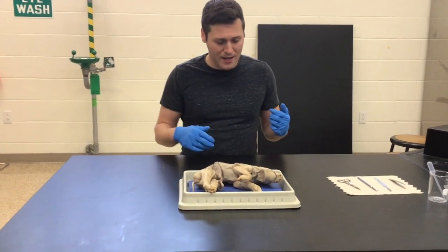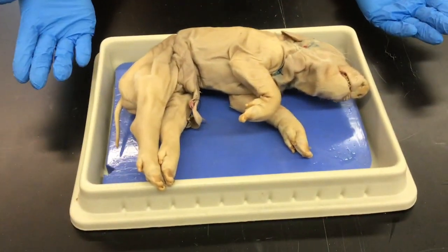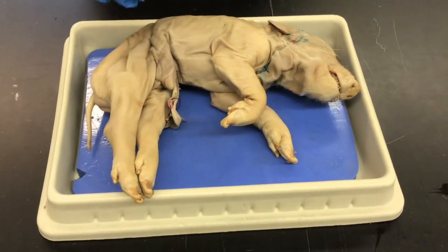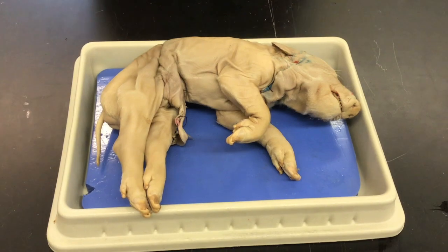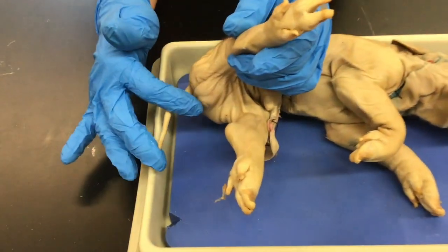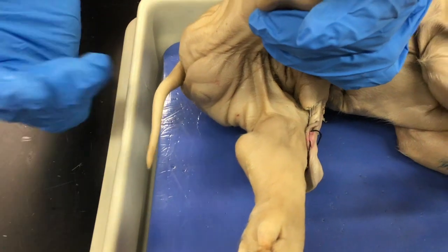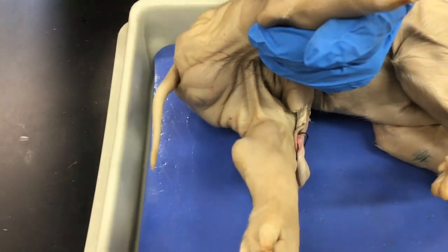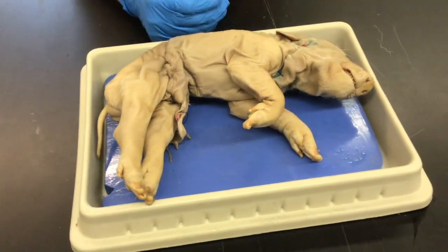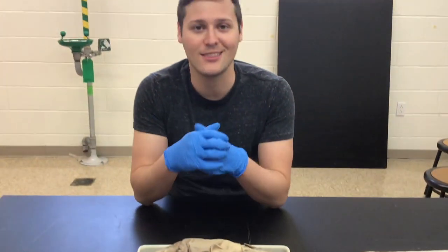So if you come on in and take a look at our pig — our specimen here — you can see that it is in fact a pig. One thing I want to note before we actually start cutting the pig open is the gender. If you look between the pig's legs, you see this bulge. That right there indicates that it's a male — these are the testes. If it was a female, there would be an additional hole besides the anus. So we're going to cut the frame so you can see an overview of the pig, and we're going to initiate the dissection.